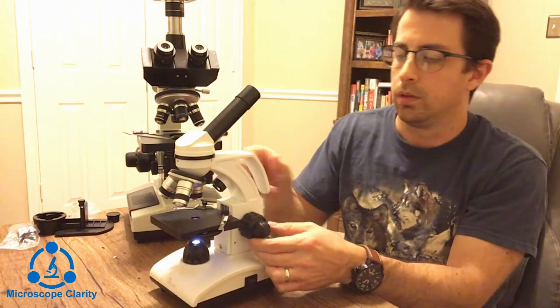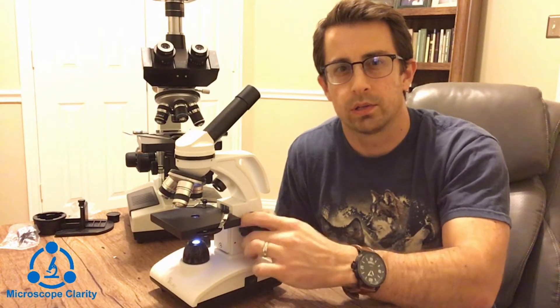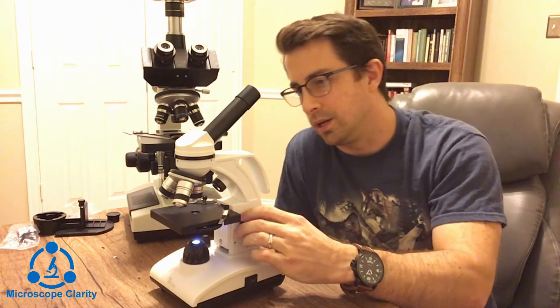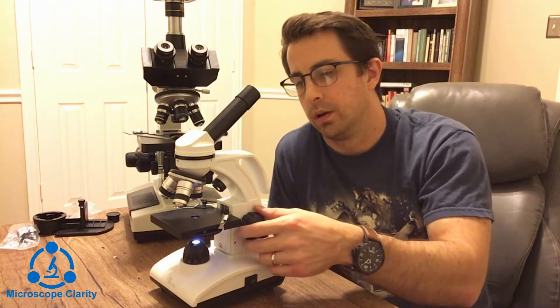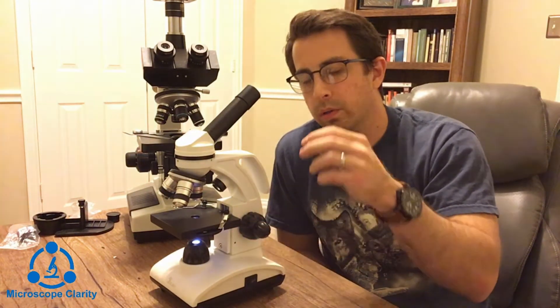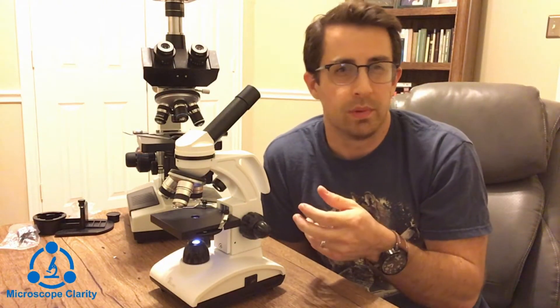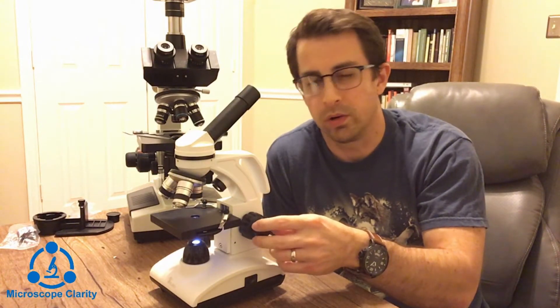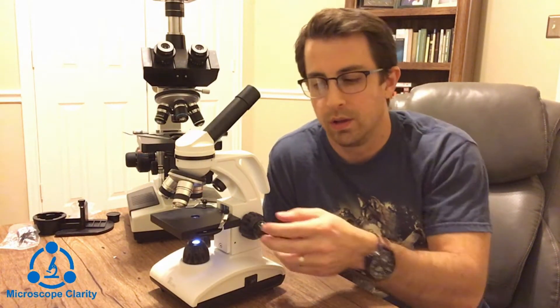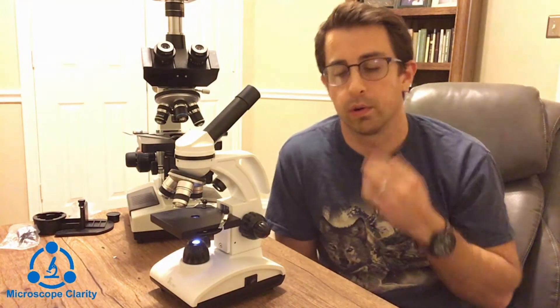The larger knob is your coarse focus knob, and that moves the stage more rapidly. Typically you're going to use the coarse focus knob on the lower power objectives just to get the specimen in focus quickly. Then on the fine focus, when you're on the higher powered objectives, you just slightly move the stage up and down to get the specimen in focus.